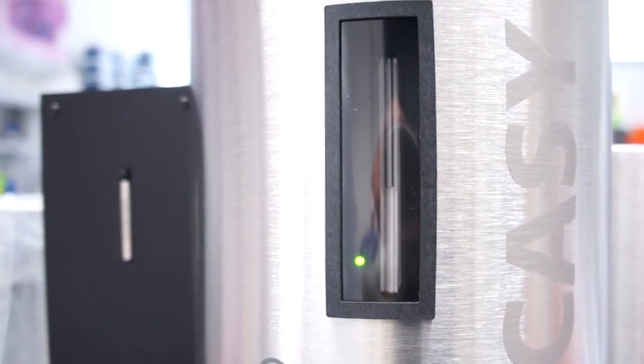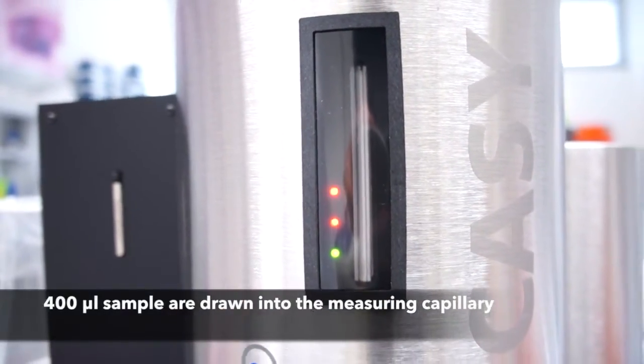For each measurement cycle, 400 microliters of sample are drawn into measuring capillary.